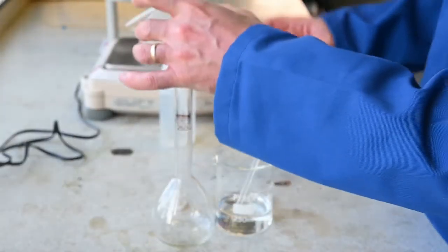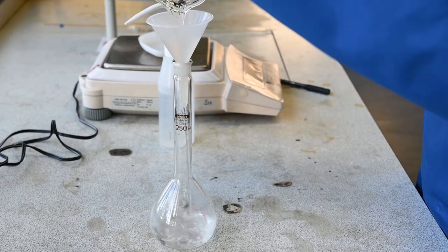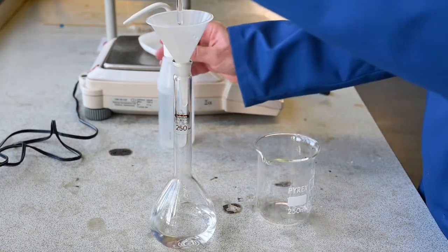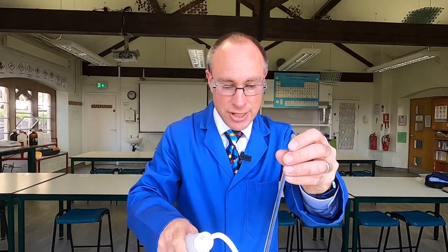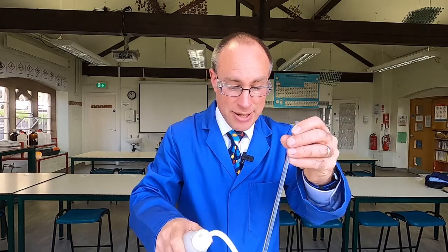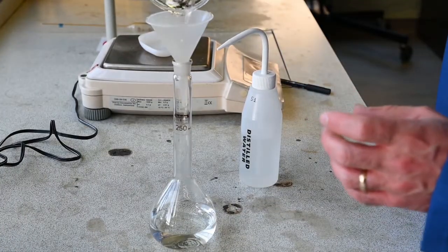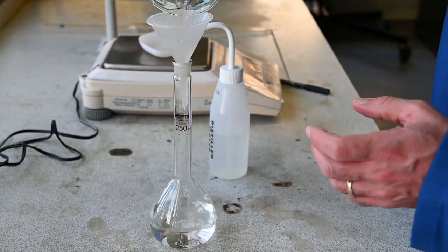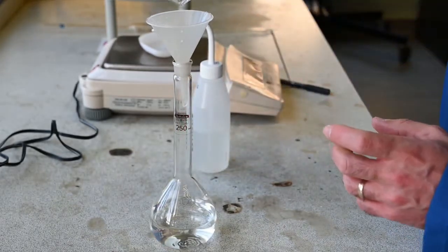I'm then going to transfer that solution into the volumetric flask using a funnel and pour the solution in. There's a little bit of solution on the stirring rod, so I'm just going to use distilled water to rinse the stirring rod, making sure that all the solution on it is now in the flask. I'm also going to rinse round the beaker two or three times to make sure all of the acid in the beaker is transferred into the flask.